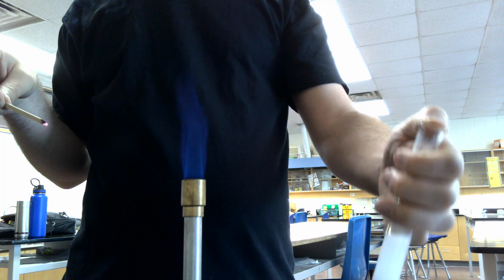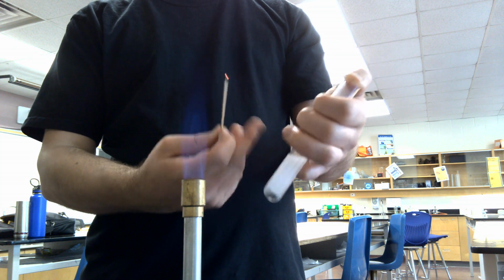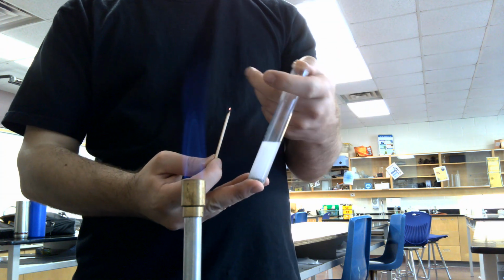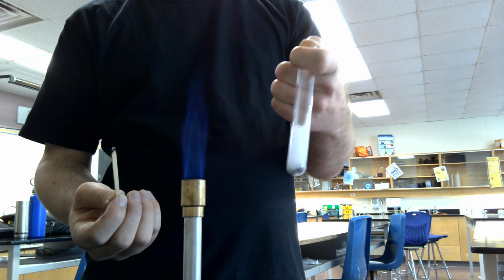So there you've got a nice little pop. What that actually tells us is, usually you do one of two tests: either the burning splint test or the glowing splint test. The glowing splint test usually indicates oxygen when it reignites, like we just saw with the hydrogen peroxide and manganese dioxide. A burning splint, when you hear that pop, indicates an explosive gas. In this case, since we have hydrochloric acid and zinc, that is hydrogen gas. That indicates the presence of hydrogen gas.